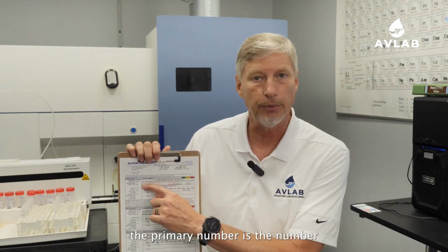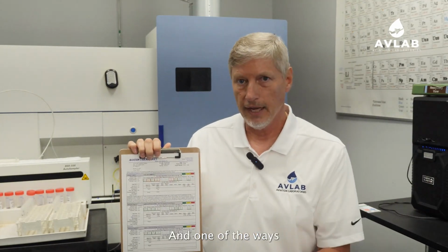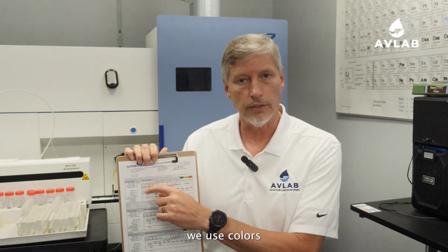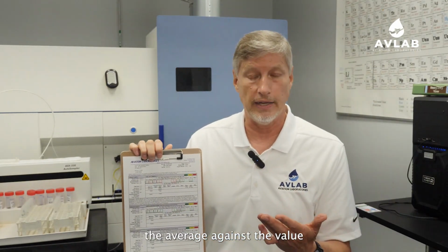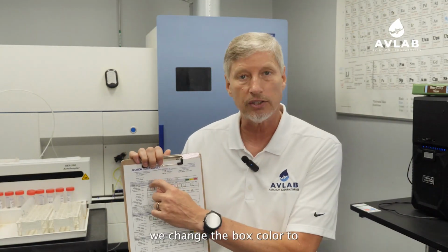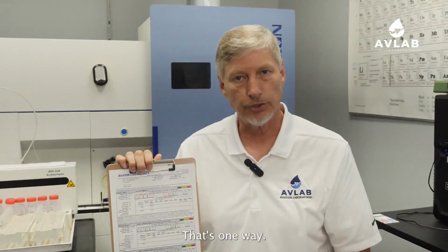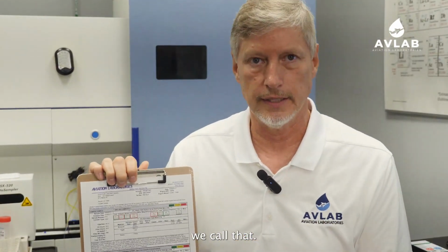The top number, the primary number, is the number that we've gotten from your oil sample. One of the ways we use colors is that we compare the average against the value that we've gotten for your sample, and if there's a significant difference, we change the box color to yellow or red. That's the first way. Comparative statistics, we call that.